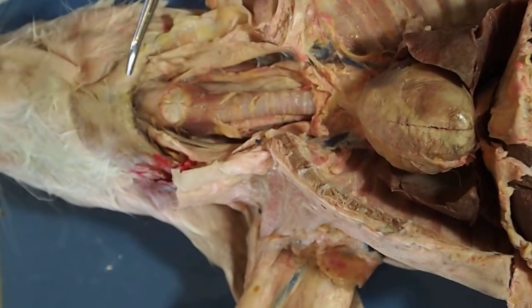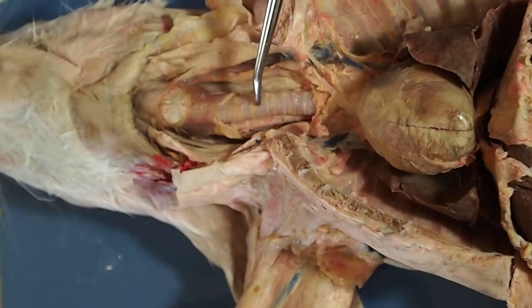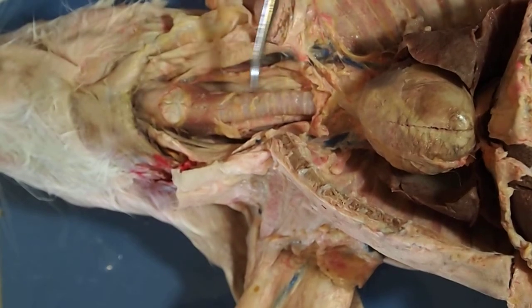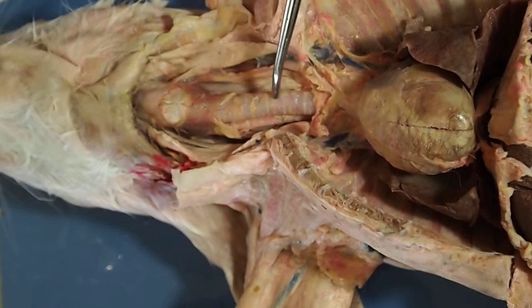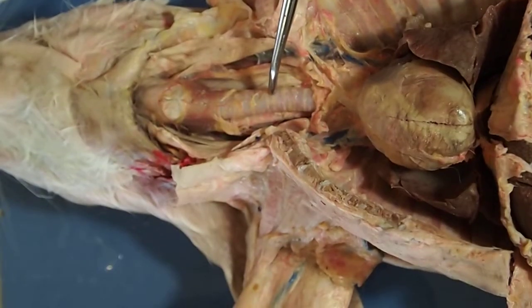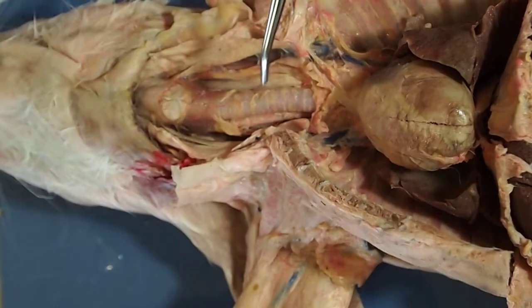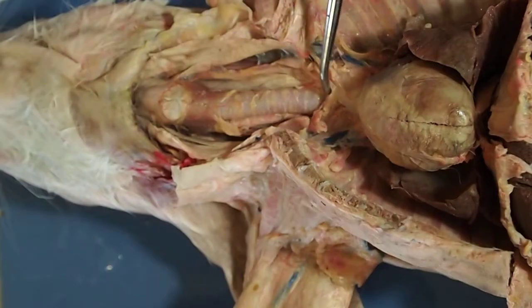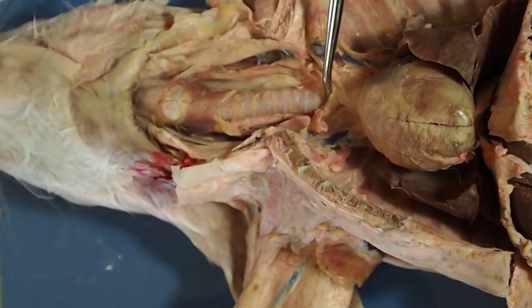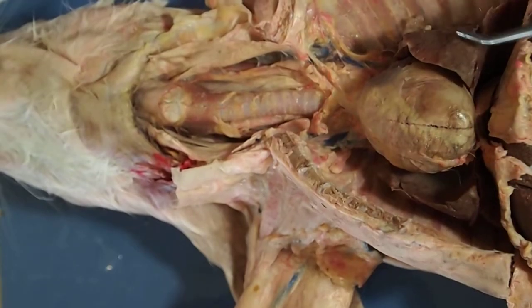Air moves down through our larynx, then down through our trachea. The trachea is reinforced with hyaline cartilage rings — from the tissues in your lab document — so that the trachea does not collapse. The trachea will eventually branch off into our two lungs.